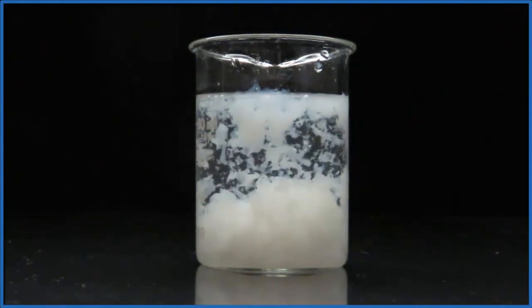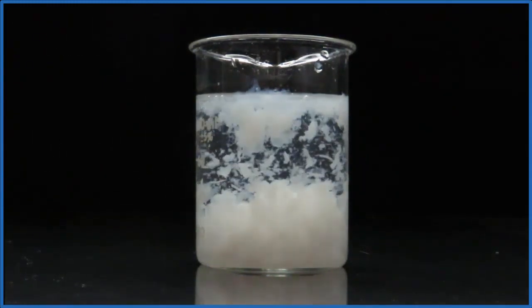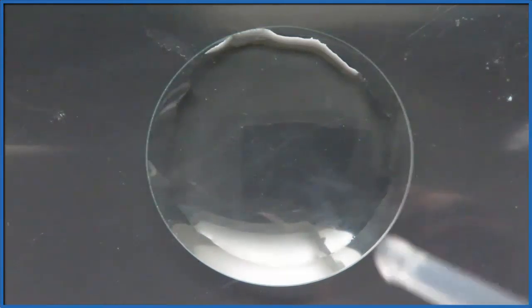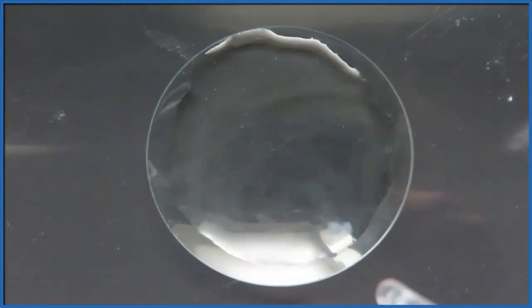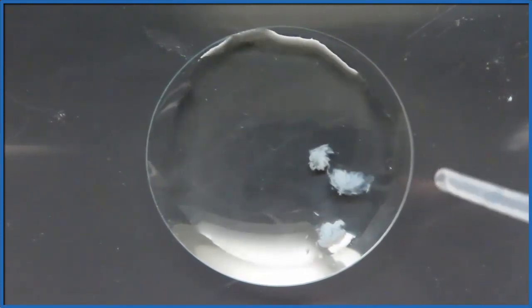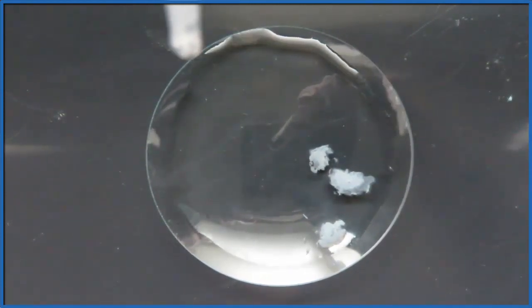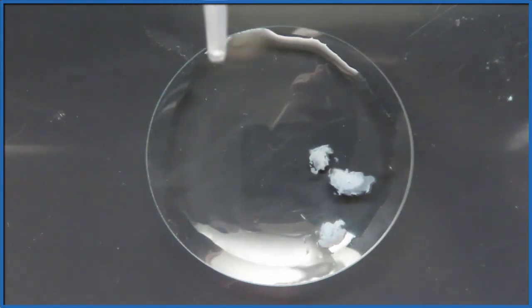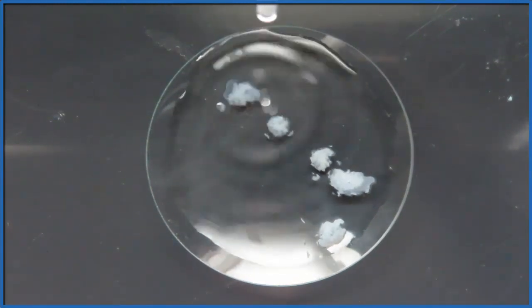Let's keep adding the sodium hydroxide and then come back in a while and see what that looks like. So you can also drop the sodium hydroxide into a petri dish with magnesium sulfate, and you can see those little blossoms of the precipitate forming as soon as that drop of sodium hydroxide hits, you get this little, almost looks like a flower blossoming.